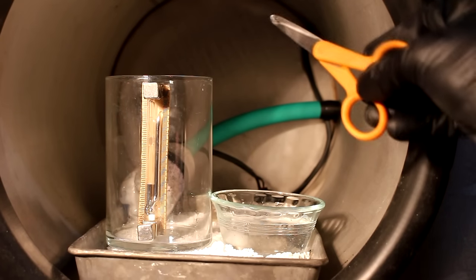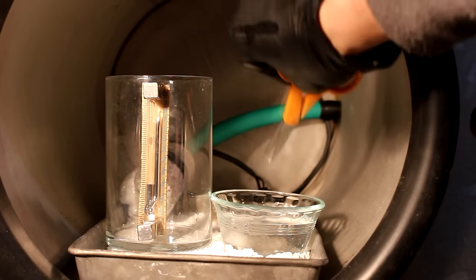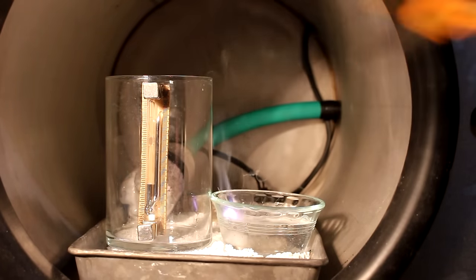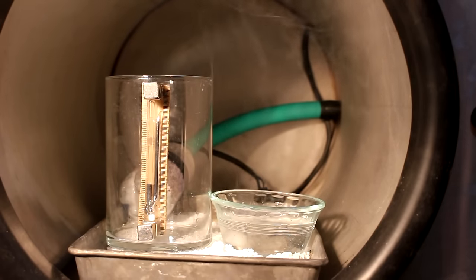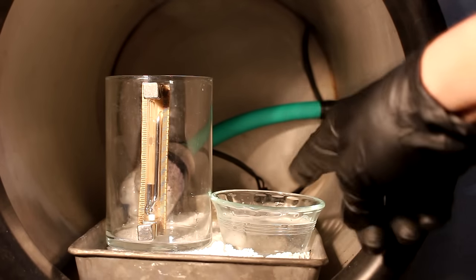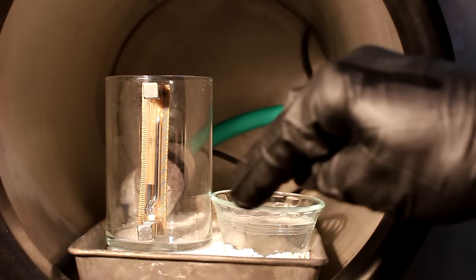So you may know what happens when you put potassium metal into water, but just as a refresher, you can see it ignites and burns with a nice purple flame. This produces hydrogen gas and lots of heat. The hydrogen, of course, ignites.